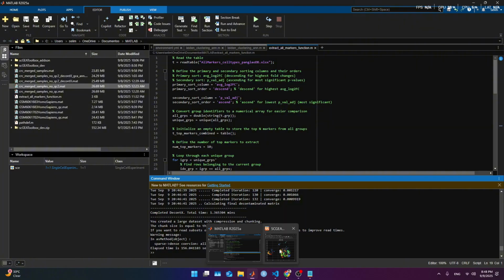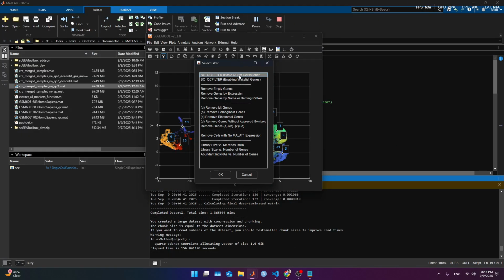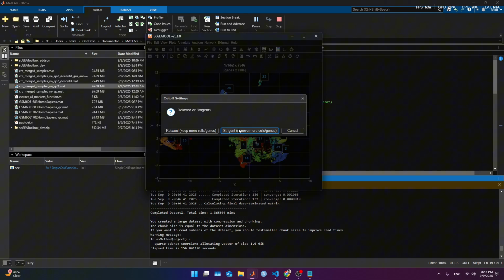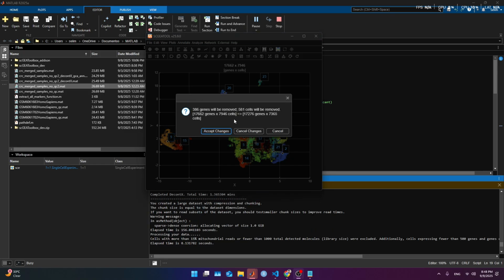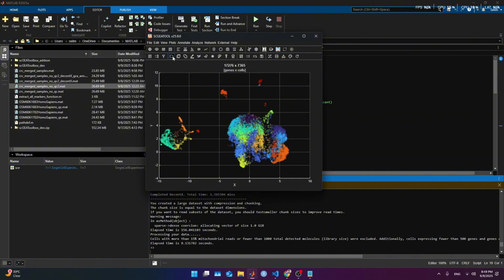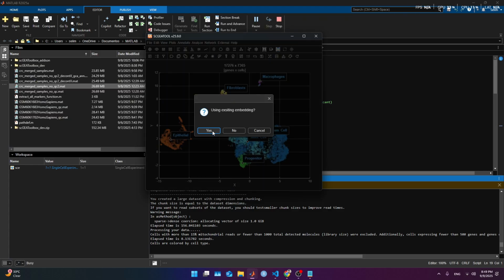What we end up having is what we saw, and what we have to do for looking at the changes is executing again the QC filter, similar quality as we did before. In this case, we did a stringent one before. We are gonna do a stringent one this time as well. And then we do that, and it's gonna take a few minutes, seconds maybe. Gonna stop it for now. Then it finished, and we get that it is reduced from 17,600 genes to 17,200, and cells reduced by 600 around. We accept. And we should have something similar as before, but if we do the UMAP again, it should look cleaner.